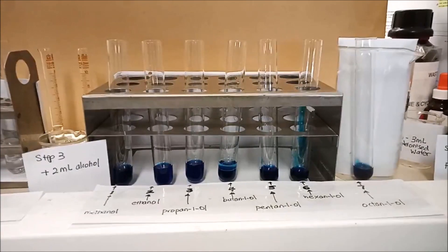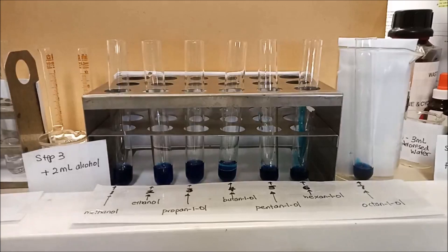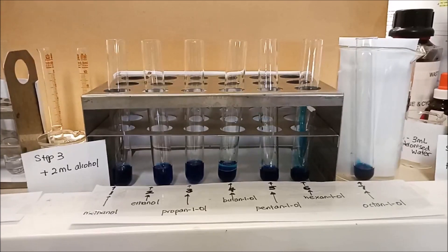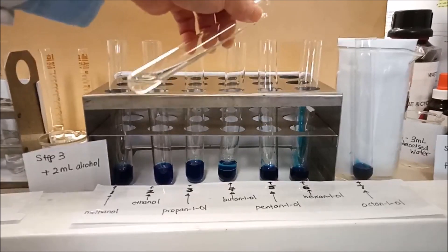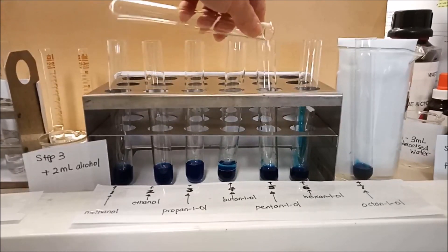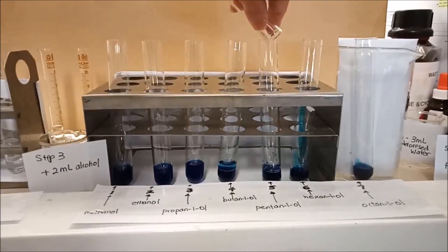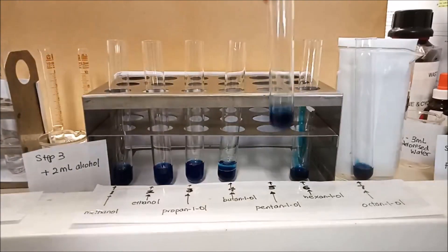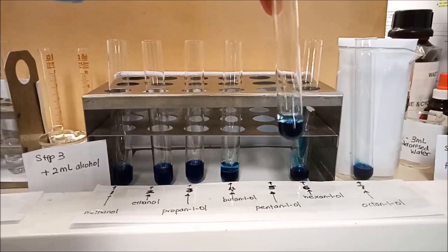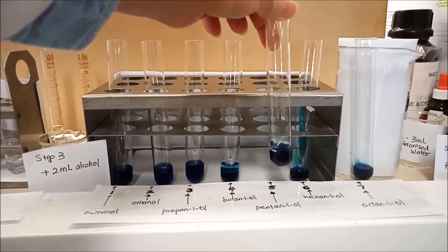And the last second layer is the fifth carbon chain that is pentanol. And let's see what happens when we add two mils of pentanol to three mils of water.